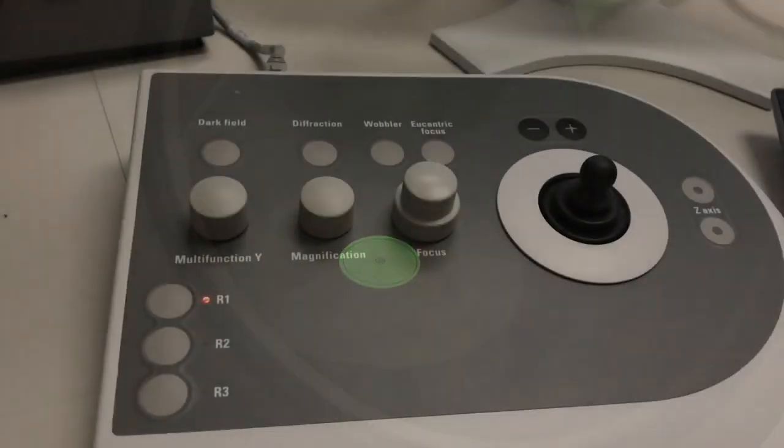Before getting started, just like when you're doing normal TEM imaging, you have to perform your basic alignment. So we have spot size 1 selected, which is typically what's used when doing two-beam imaging, and specifically when doing weak beam dark field imaging, that's always the spot size you should use. You want to set the sample at eucentric height, center your C2 aperture, correct your condenser astigmatism, and perform rotation centering, just as you would normally. From here, what we're going to do now is actually set up the two-beam condition.